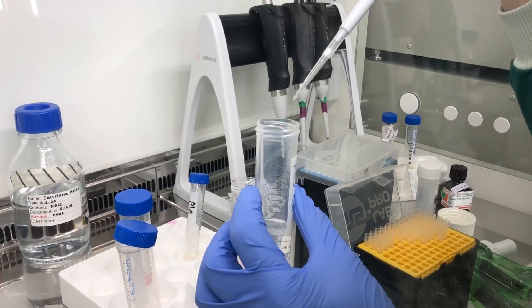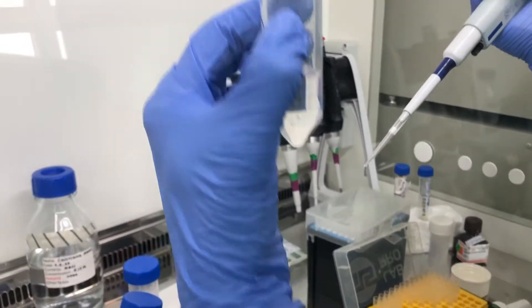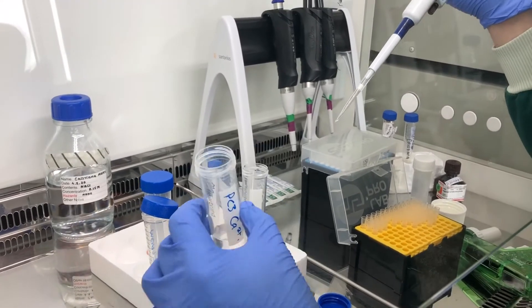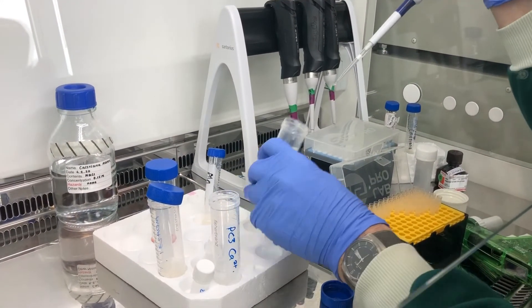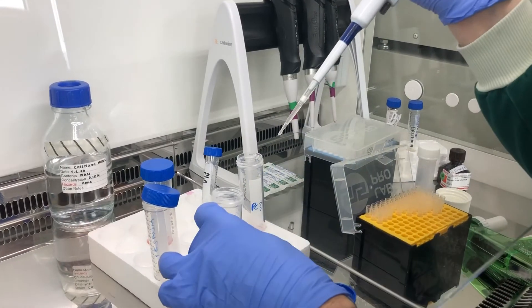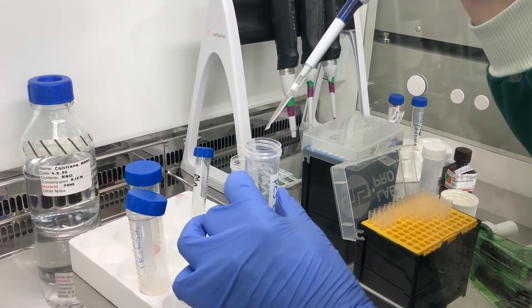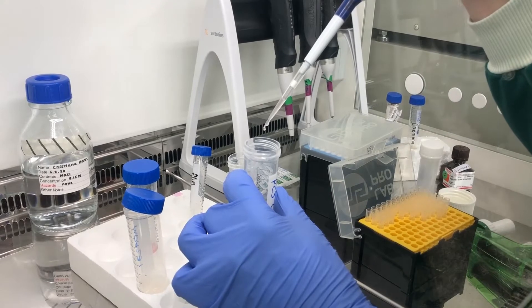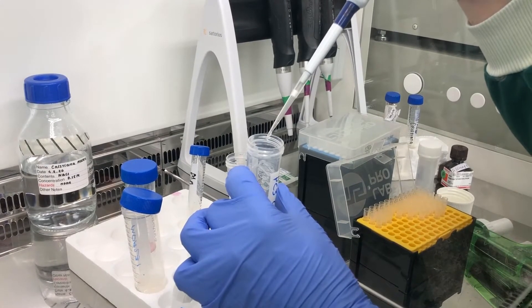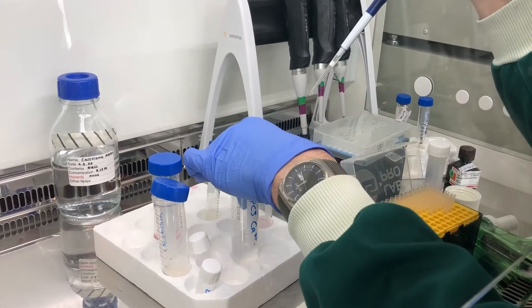It's about half a million cells per ml, so I've put 200 microliters in there and I can see 10 or so nice alginate beads in there. So I'm just going to do some more. Obviously I've got enough here to do about 50 beads from this milliliter of alginate and cells.